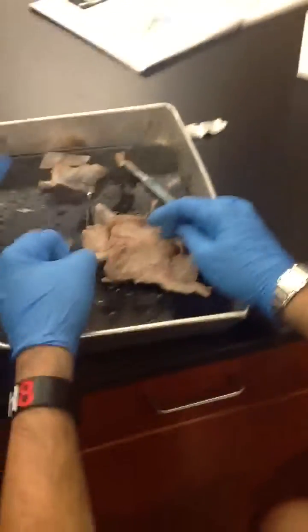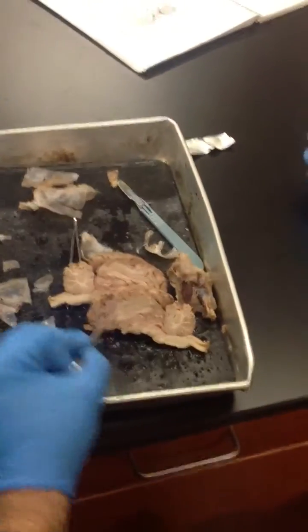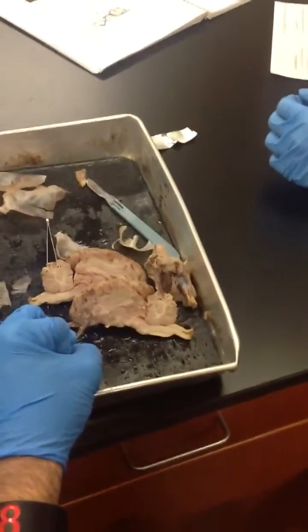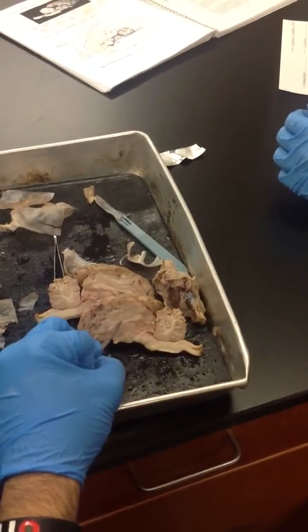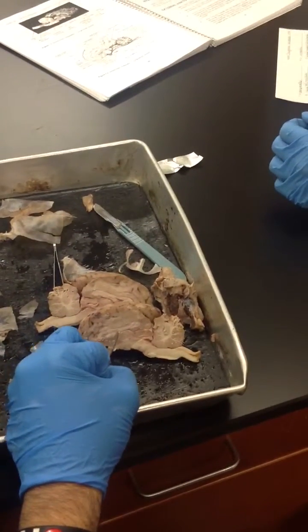Okay. So we'll go again from the inside. So you have the white on top. This is disclaimer. Everything I say cannot be 100%. I'm pretty sure, because sometimes I even mess up what I say. So the white on top is the corpus callosum. And then the white on bottom is the fornix.